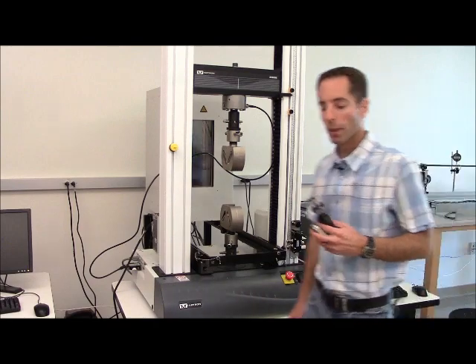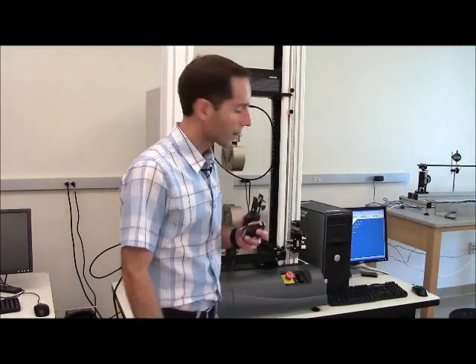Of course, we have a computer with a monitor and Blue Hill running at this point in time, and we'll have a specific video on how to program Blue Hill, the Blue Hill software with the test profile that you're interested in.